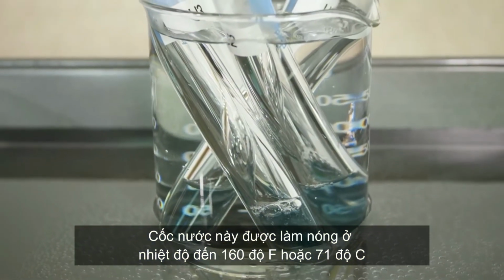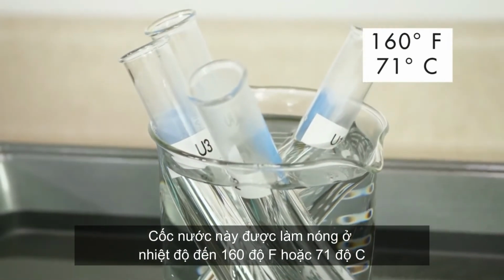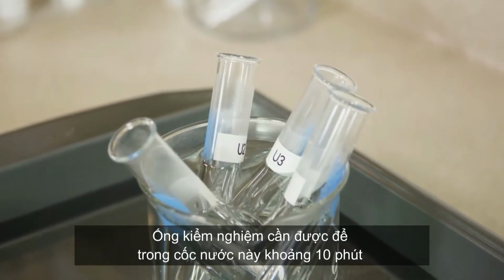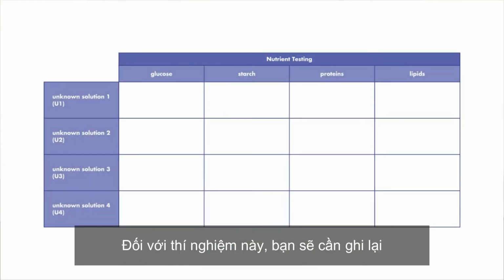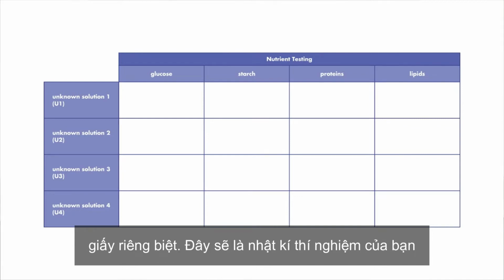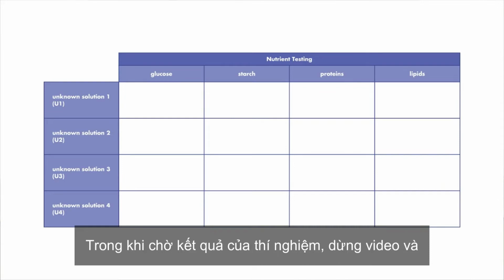This water bath has been heated to 160 degrees Fahrenheit, or 71 degrees Celsius. The test tubes need to stay in the water bath for 10 minutes. For this lab, you will need to record your observations in a notebook or on separate paper. This will be your lab journal. While we wait for the test results, pause the video and set up your journal.